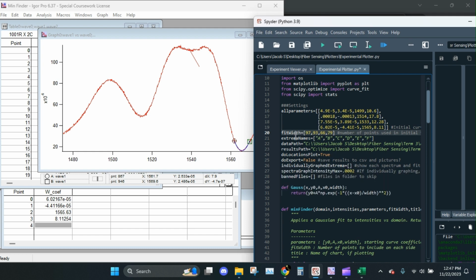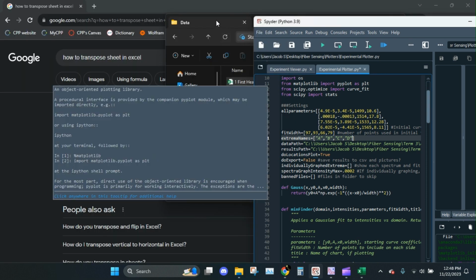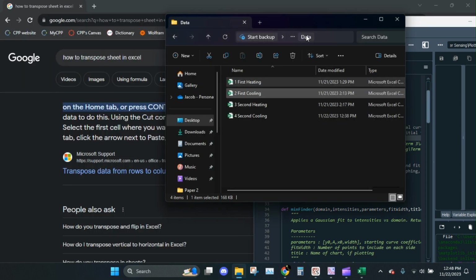Okay. So here I'm doing 4 extrema. I'm trying this one. Again, I kind of doubt it. And this one. So 4, we only need 4 names. A, B, C, and D. All right. We shouldn't need Igor anymore. Yay.